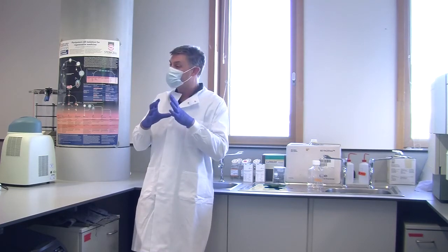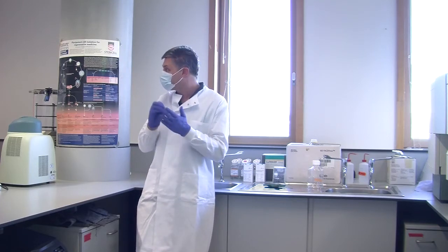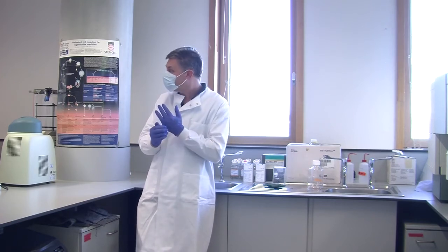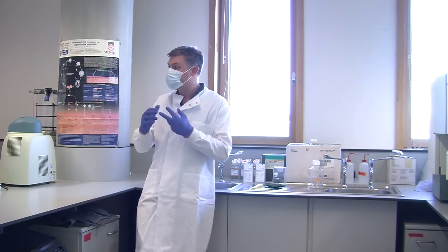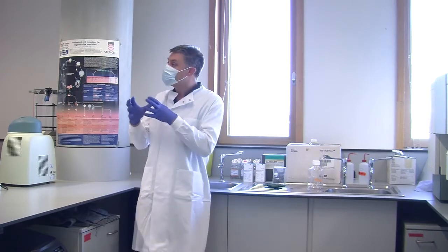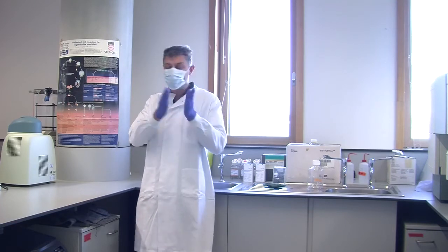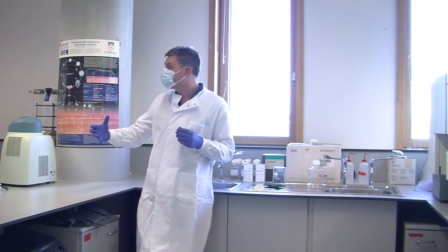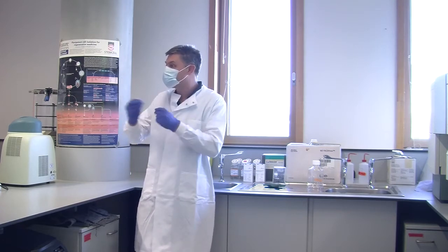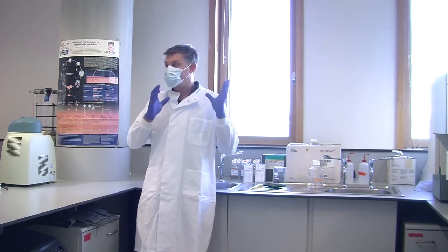But the very basic explanation is it looks at cells one after another, it shines a laser at them, it looks at their size, it looks at how granular they are, and it looks at how much fluorescence they produce. Because with fluorochromes, you only get light given off when you put light in. So we put light in with a laser, we get coloured light coming off. And because we're using different antibodies with different fluorochromes, we get different coloured lights for each of the different markers. Okay?